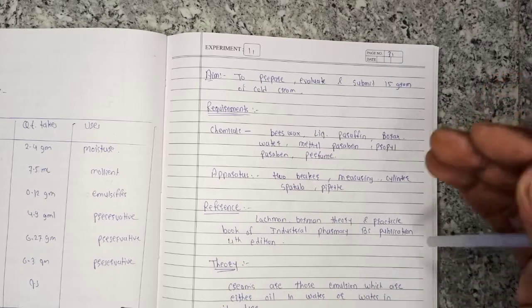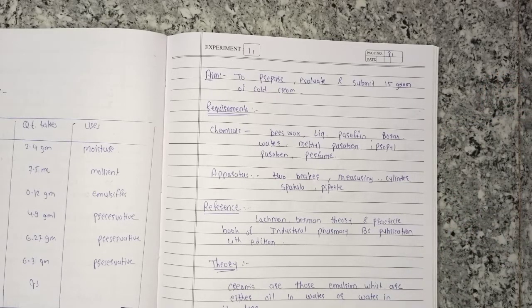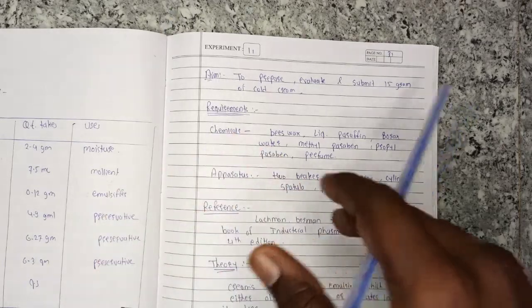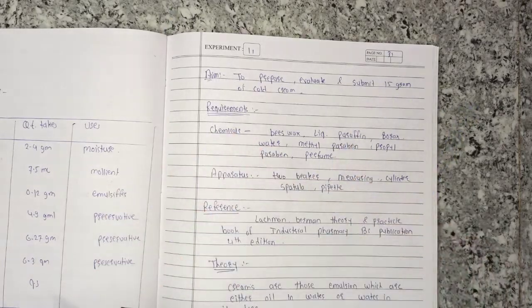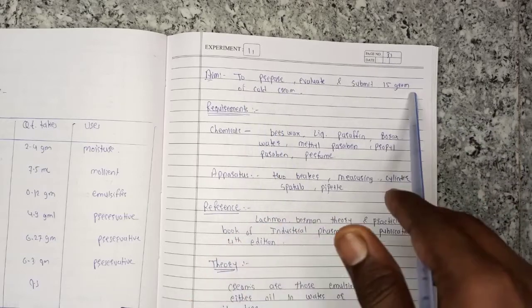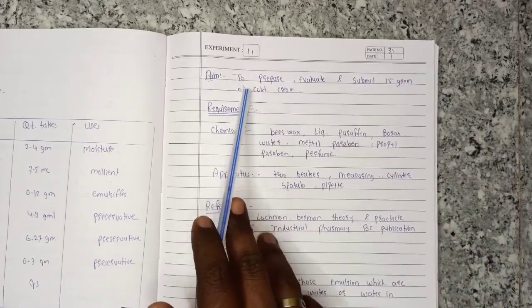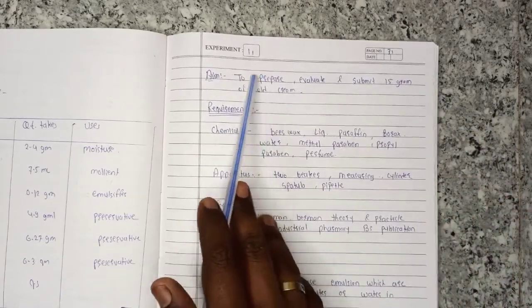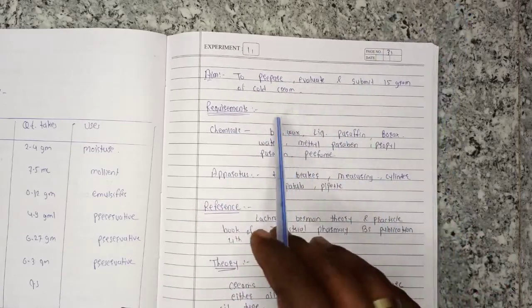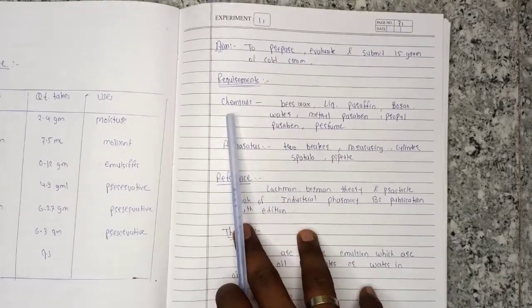Hello friends, welcome to this video. In today's video we will see Industrial Pharmacy 5th semester practical number 11. In this practical we will see how to prepare, evaluate, and submit 15 grams of cold cream. First of all, we will see the requirements.